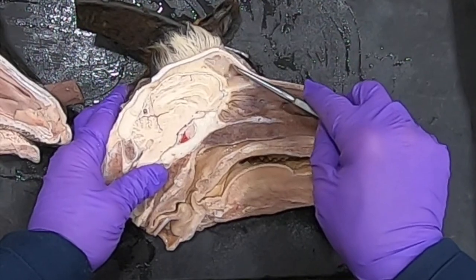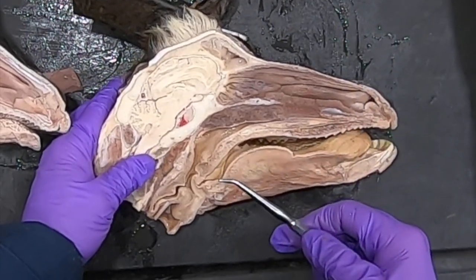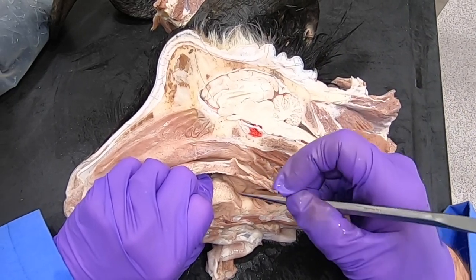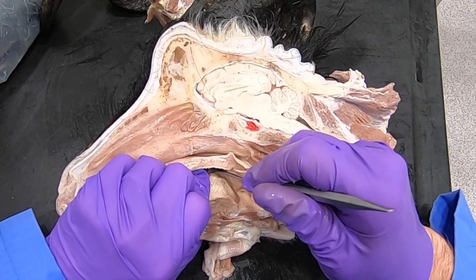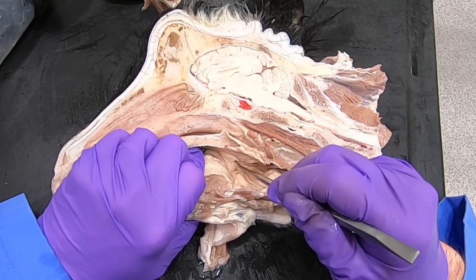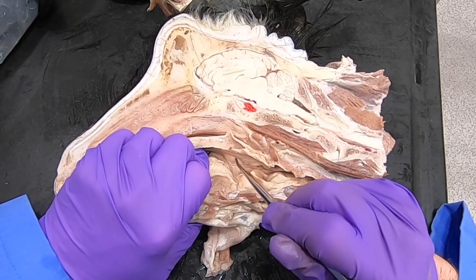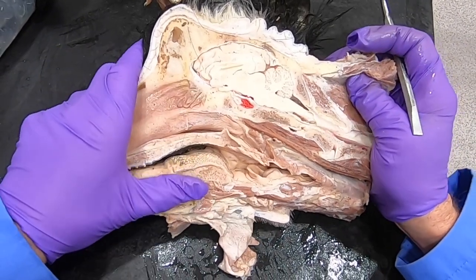We have nicely opened up the frontal sinus. Opening this up a little more, we can just barely see the palatoglossal arch, which is the beginning of our oral pharynx. And here in our oral pharynx we see this hole — this is actually the palatine tonsil. There is a little palatine sinus in here surrounded by tonsillar tissue — that's the palatine tonsil.